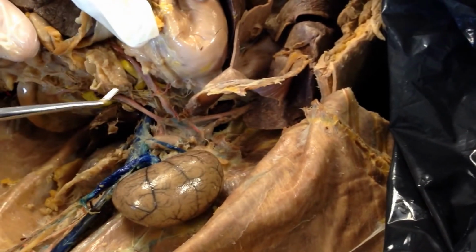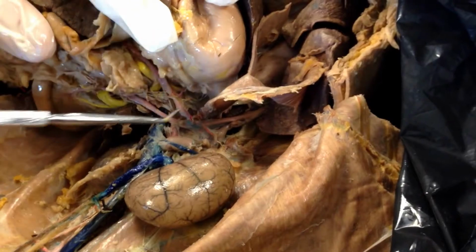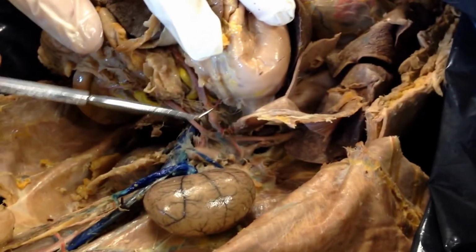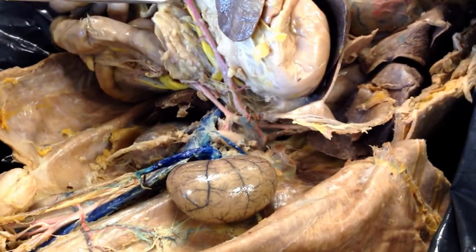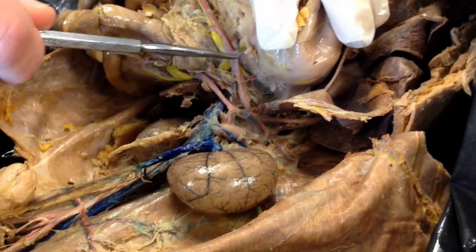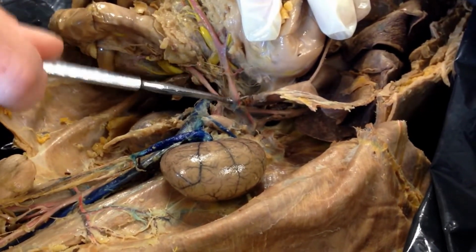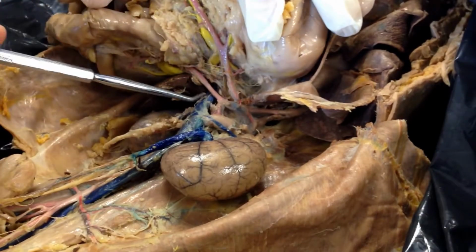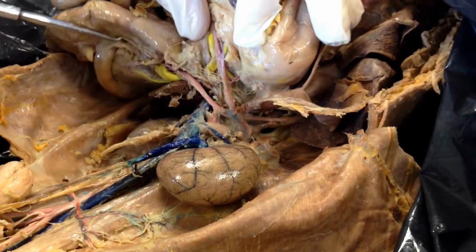The celiac artery is important because it takes all the blood to the liver, to the spleen and the stomach. So the hepatic, gastric, and splenic arteries all come off of this. You can kind of see some of those branches as we fold stuff back and out of the way. It comes up here and splits to all these other spots. But this is really the part you got to know, this trunk of it is called the celiac artery.